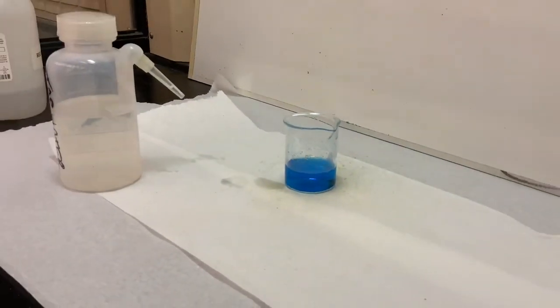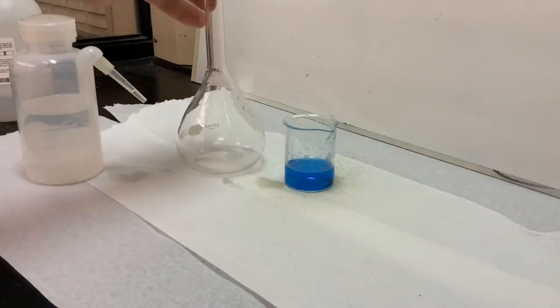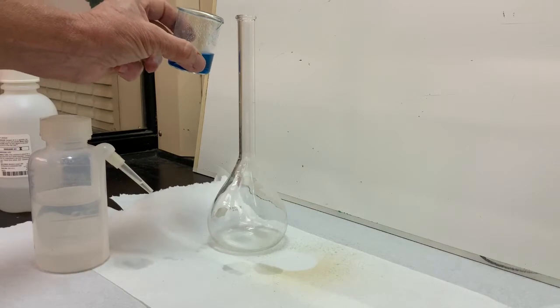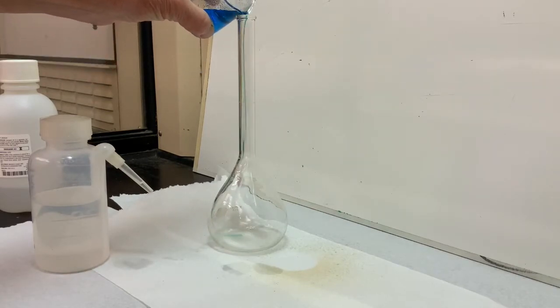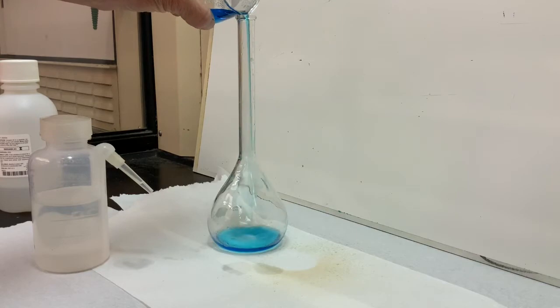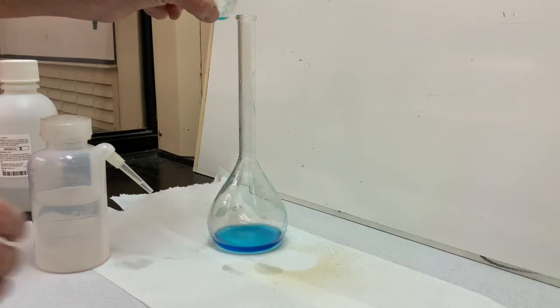Now we'll bring in a 250 milliliter volumetric flask and transfer quantitatively, meaning transfer all of the solution, into the flask.